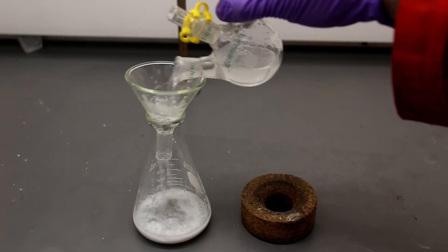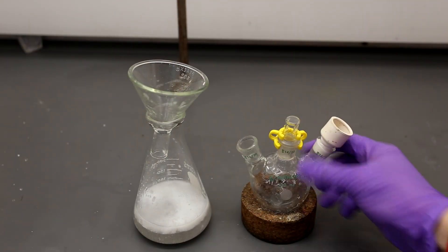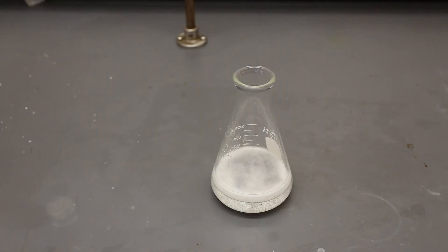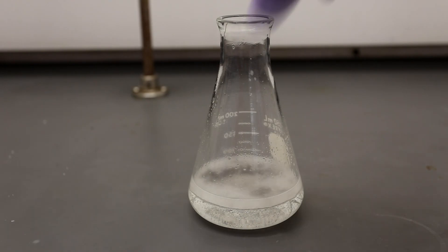I did my best to wash out as much product as possible, but there still was some that remained in the three-necked round bottom. After the addition of the hydrochloric acid, the solution will bubble. Swirl the mixture around and don't proceed to the next step until the bubbling has stopped.